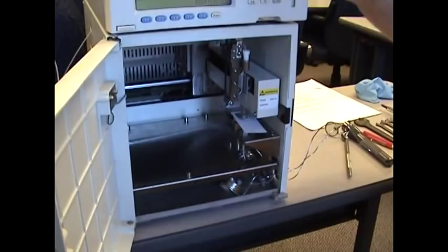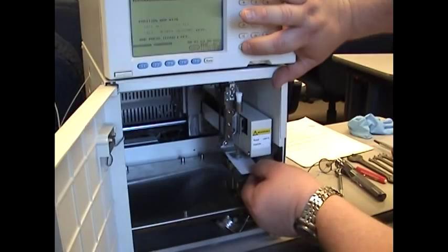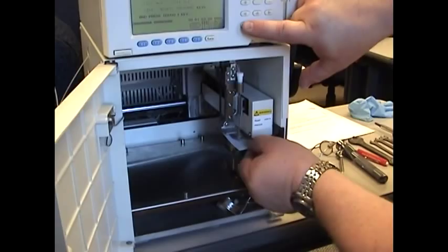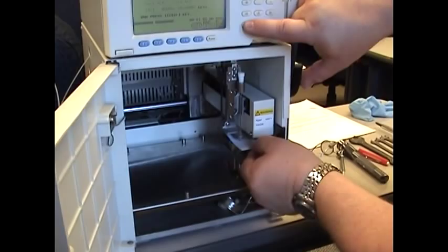Continue to move the needle down by hitting the F5, shift and the CE. When it gets close, you want to use just the CE button. This will take it down one step at a time until you see friction. Notice Steve is moving the paper back and forth. When you feel a drag, that is when you know you are at the plane of the injection port.